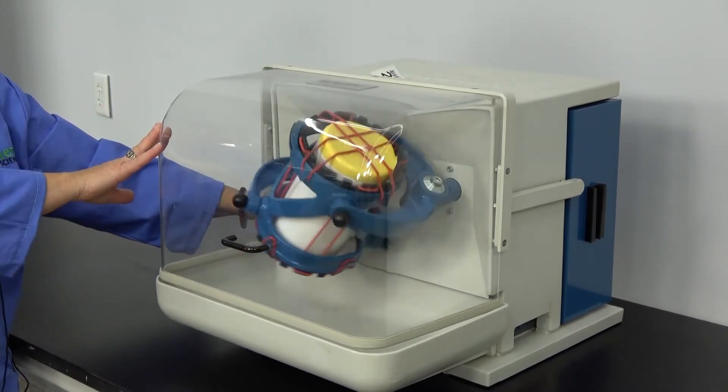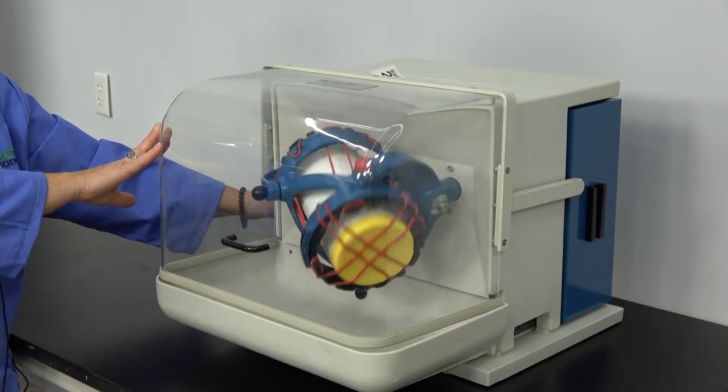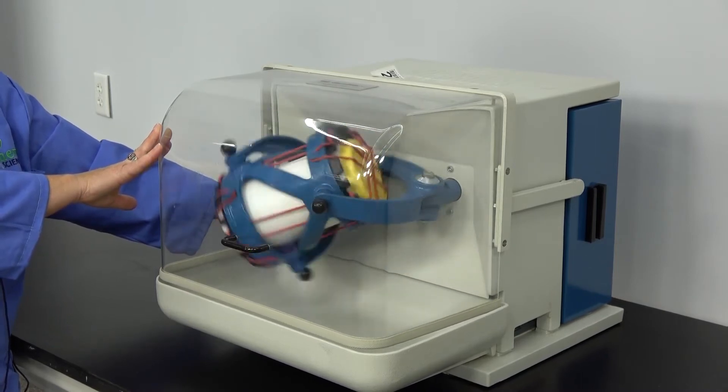Anyone operating this mixer should be thoroughly familiar with the operator's manual to avoid any injuries.